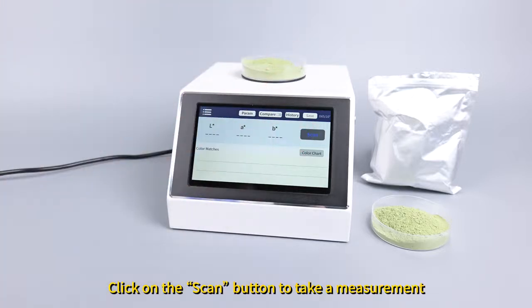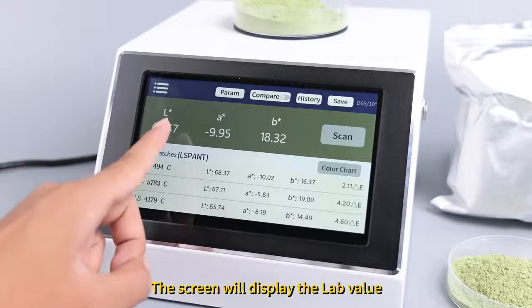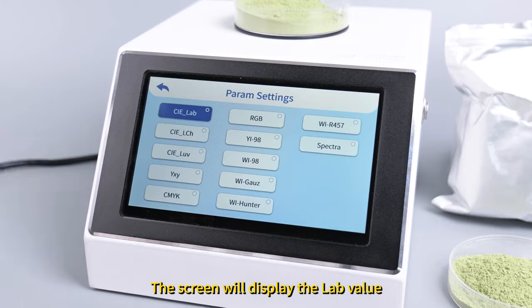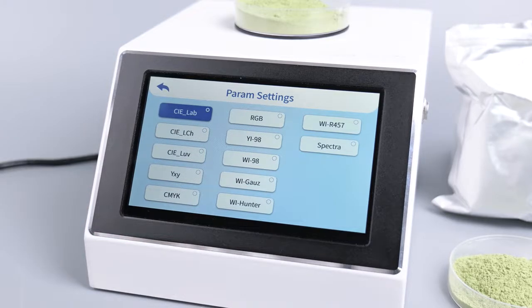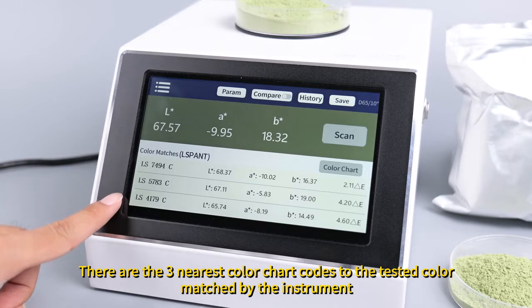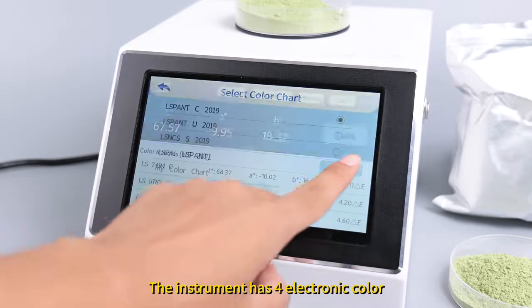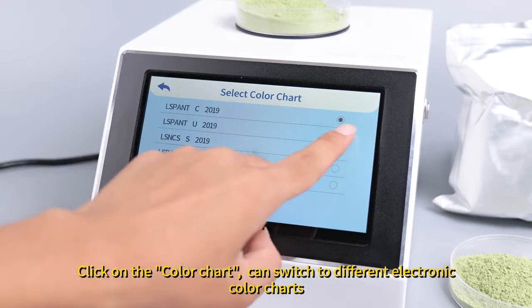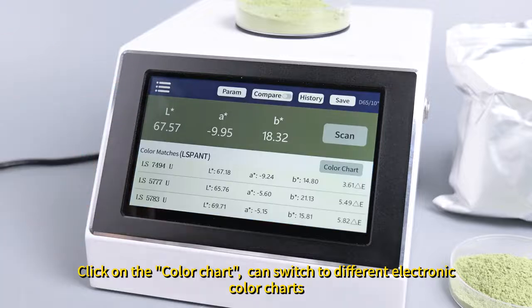Click on the Scan button to take a measurement. The screen will display the lab value. Click on the param, you can switch other color parameters. There are the three nearest color chart codes to the tested color matched by the instrument. The instrument has 4 electronic color charts. Click on the color chart, you can switch to different electronic color charts.